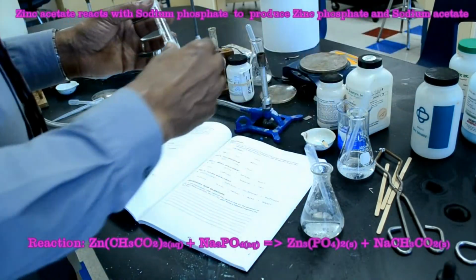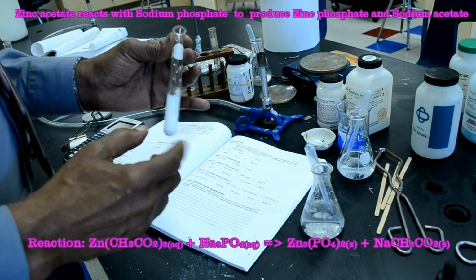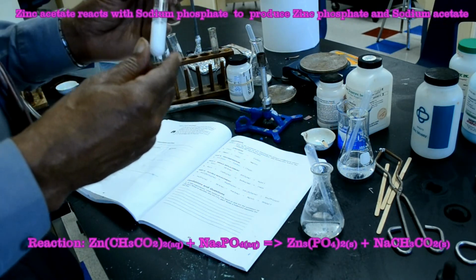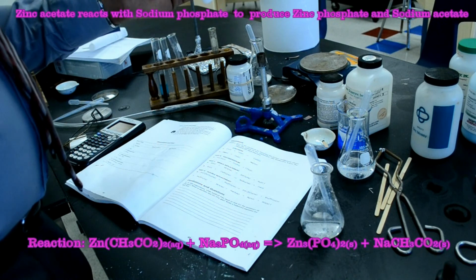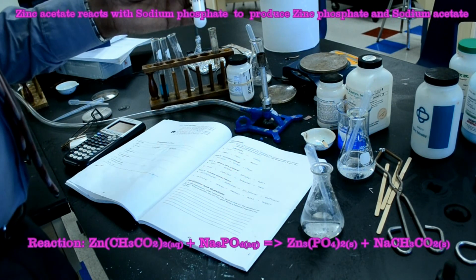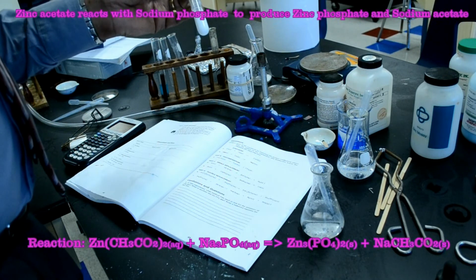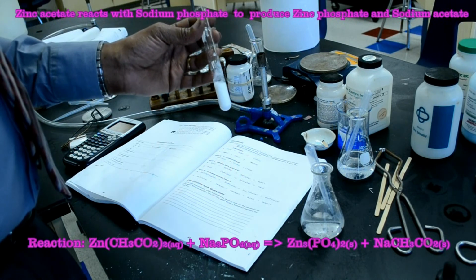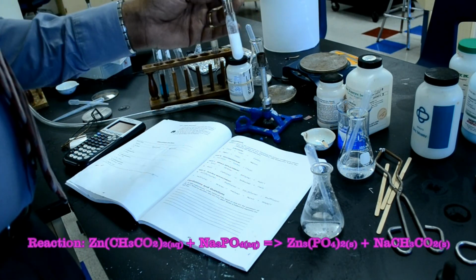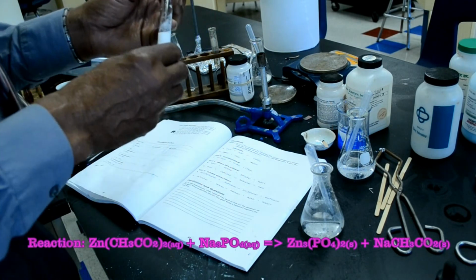So when I added the zinc acetate to the sodium phosphate, look, it made a white precipitate. When a solid is formed from a reaction, it's called a precipitate. So this reaction is called a precipitation reaction, which is also known as a double replacement reaction. So double replacement reactions and precipitation reactions are synonymous.